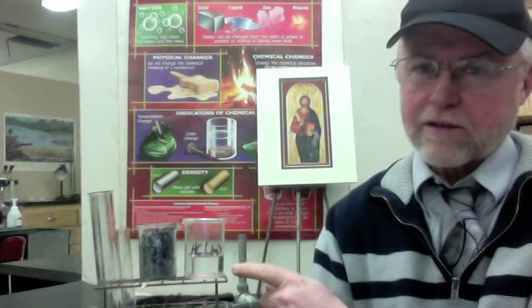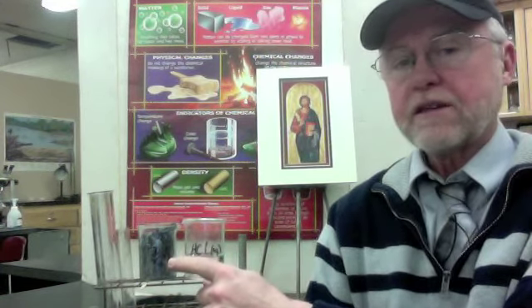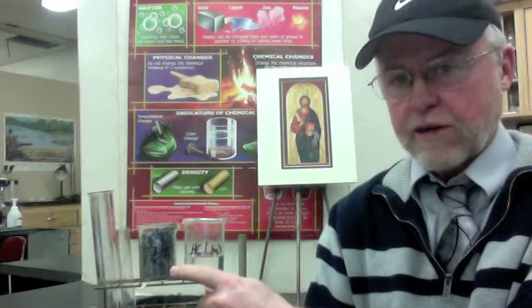HCl(aq). You know what that is? The name for that is, yeah, you knew, hydrochloric acid solution. Oh, you may have forgotten the solution, but aq means dissolved in water. And then this is Zn, which you know as zinc. So I'm going to put those two together, and we're going to see what happens. So let me do that right now.